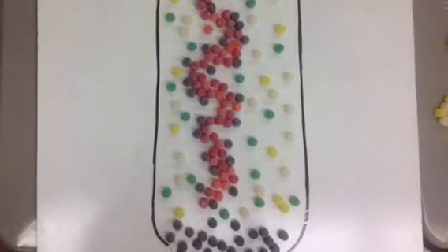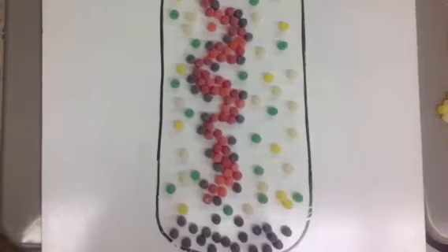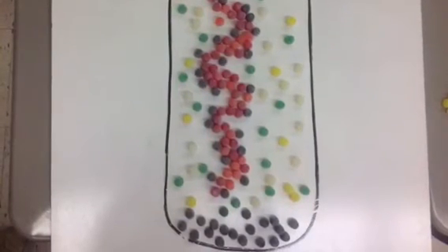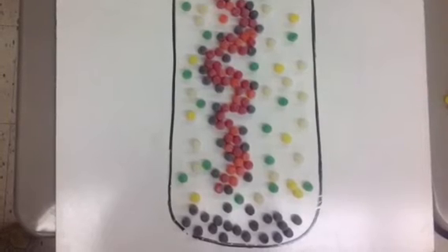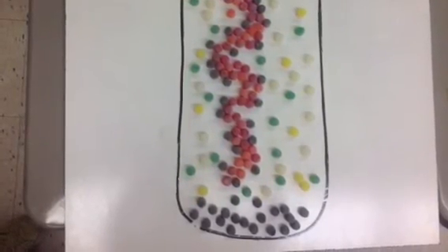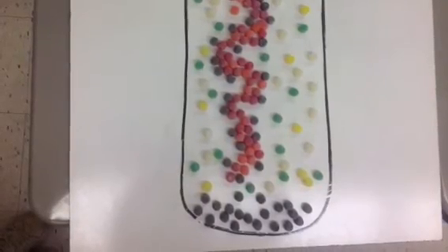This is when we have shook the tube so there is a pile of solid silver atoms at the bottom. There are already a couple silver atoms that have accumulated on the wire after shaking it. The solution contains nitrate and copper ions, and there are still some silver ions that have not reacted yet.